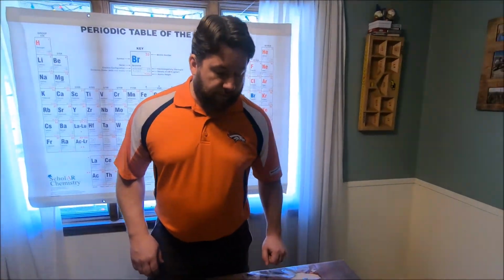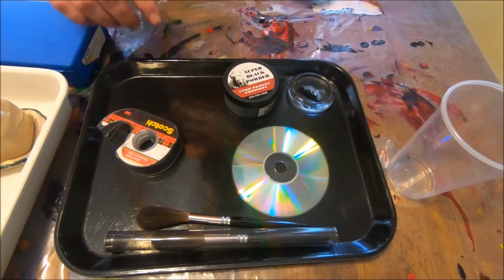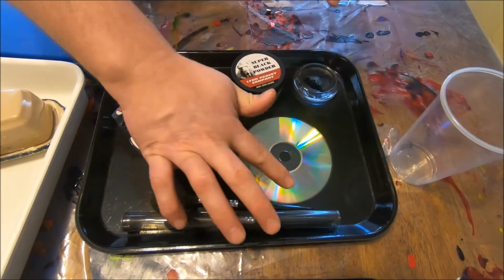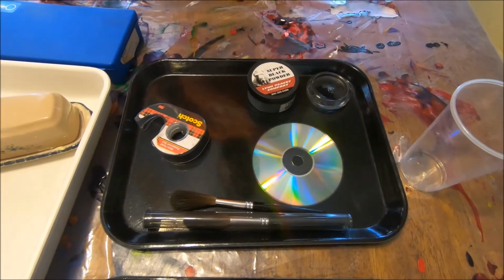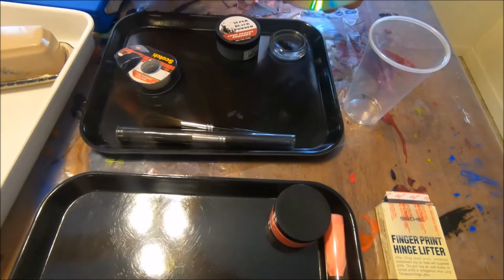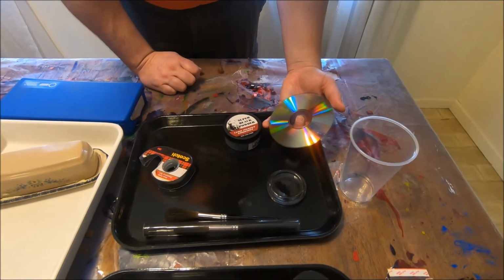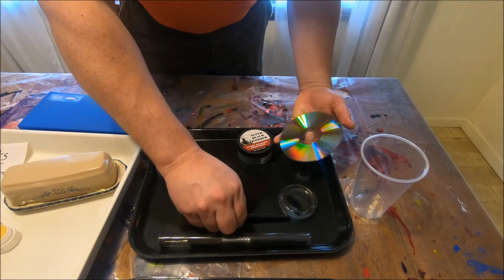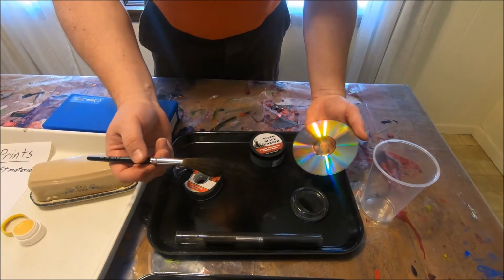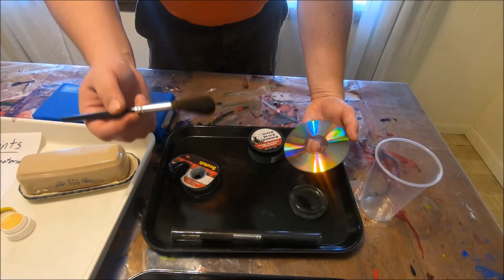So first off, if we would come up onto the scene, we're going to need to have some prints left. So first thing I'm going to do is maybe just leave a couple prints so that we can hopefully find those prints. Now to do that, what we're going to be using today is some charcoal, finely ground black powder for us. We can use many different things. We can use actual fingerprint brushes, we could use makeup brushes, both of them work very well, but our key is we do not want to over dust.